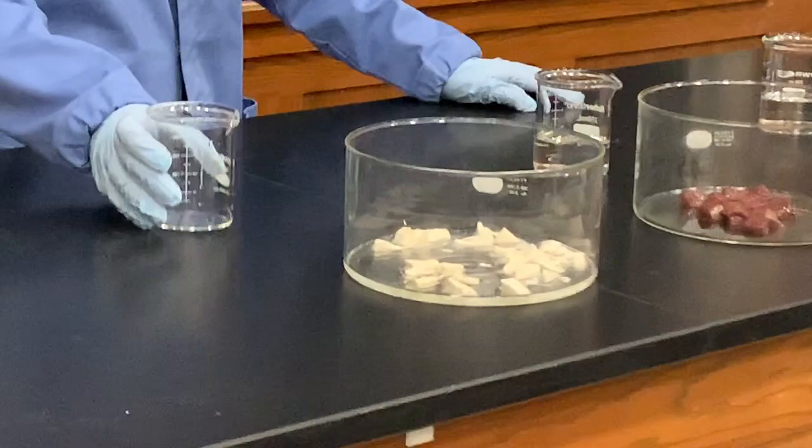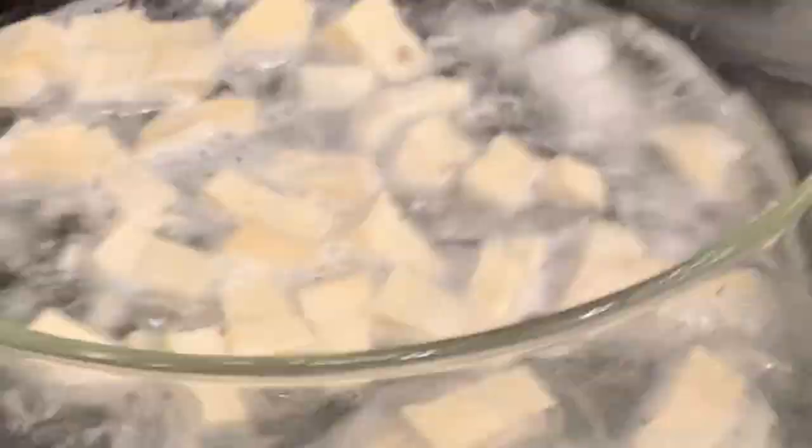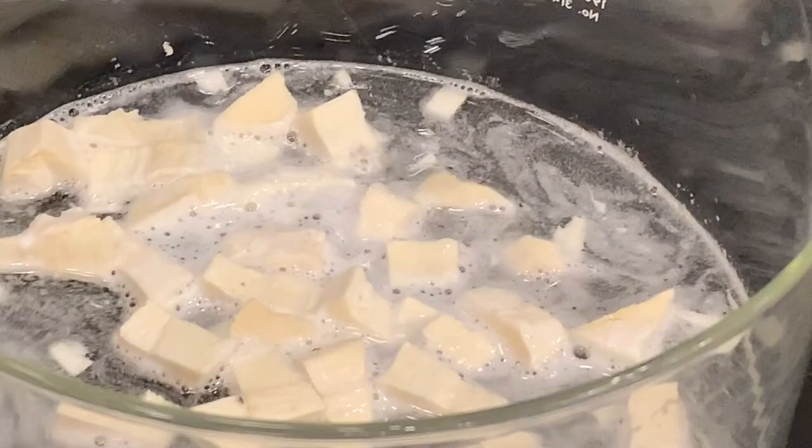We start with horseradish — there's a little bit of bubbling and reactivity, so if we zoom in you might start to see the reaction taking place. Then we go on to chopped liver, and then manganese dioxide.